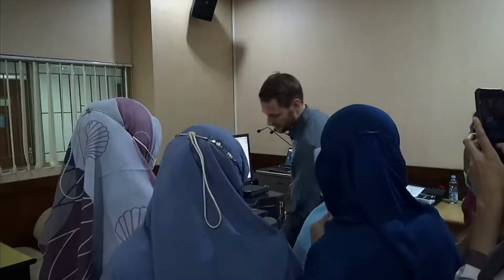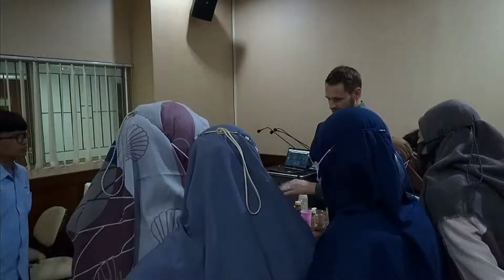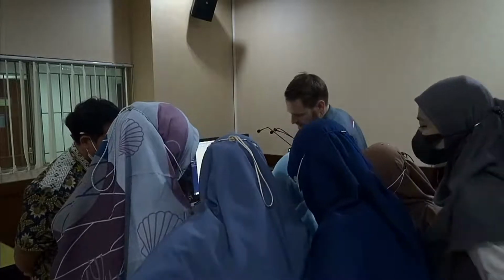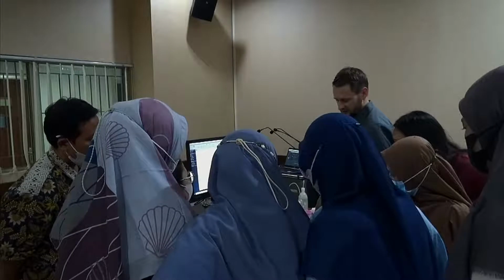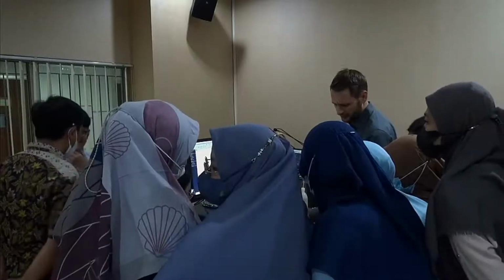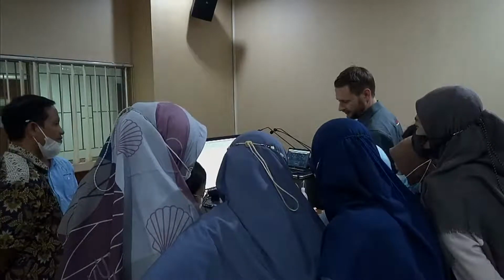So usually you would connect tap water here, which will enable you to have everything automated. You just start a measurement, you can leave, it will measure automatically, it will clean automatically, and once you're back, you have it ready to go. Since we have no water connection, no tap here, we will do a little bit of improvisation, and I will fill it manually. It's very easy, you just adjust the SOP a little bit. Maik said, just put a waiting time. I have 8 seconds to fill in new water.